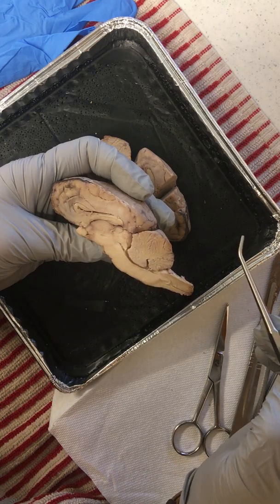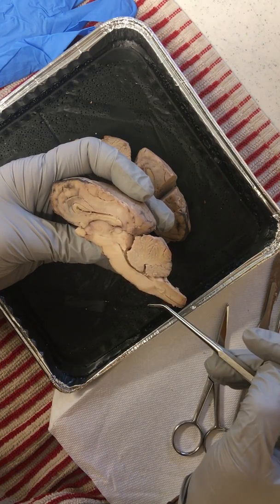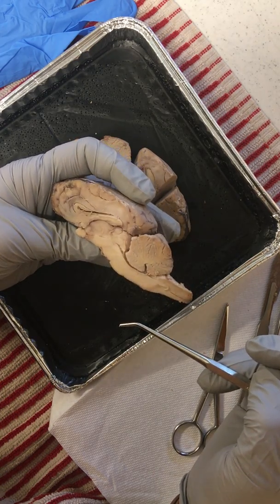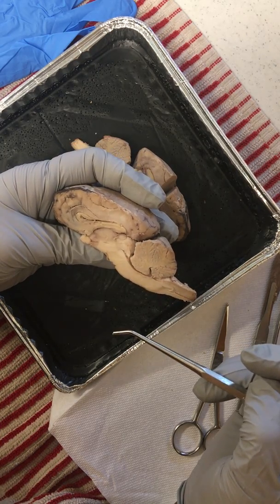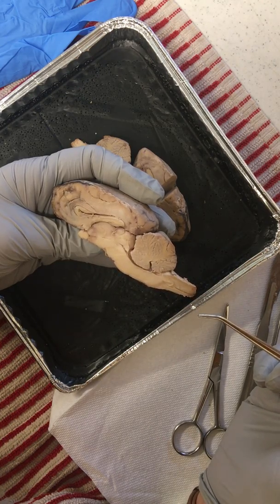And I believe that might cover everything we have here. We also have that transverse fissure as well. Again, the cerebellum is responsible for coordination. Our medulla oblongata is responsible for different reflex controls, heart rate, blood pressure, respiration, that sort of thing. And I think that pretty much completes the inner portion of the mid-sagittal structure of the brain.